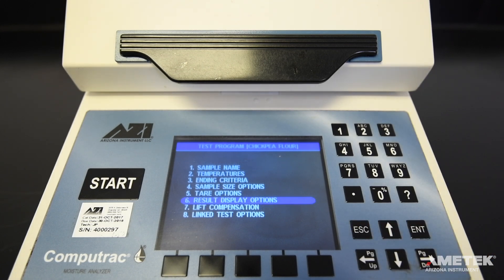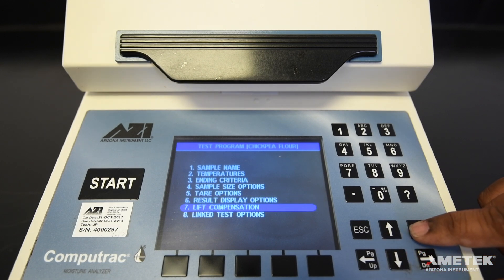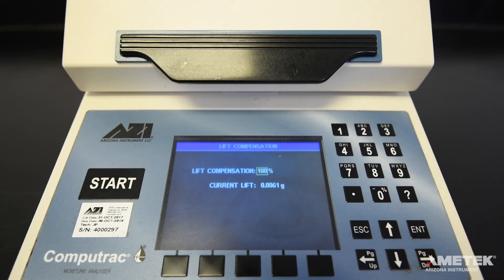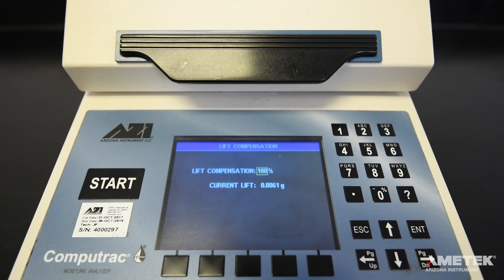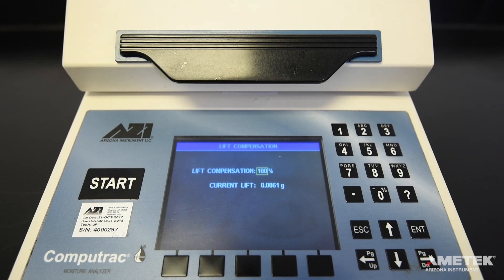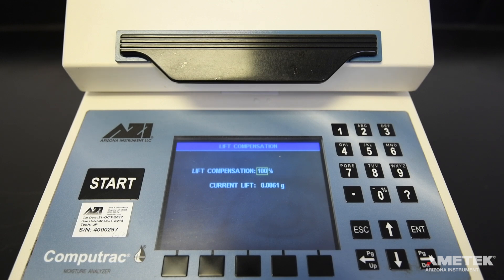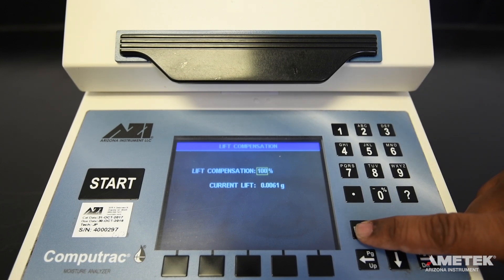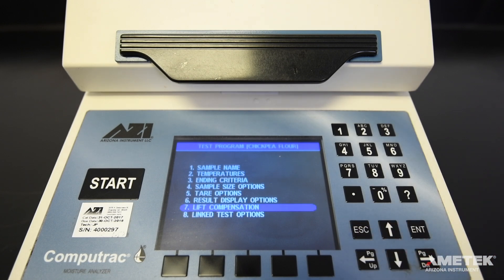Next is lift compensation. Leave the lift compensation at 100% unless otherwise instructed. The current lift field is not editable and adjusts itself automatically. When finished editing, press escape to return to the main menu.